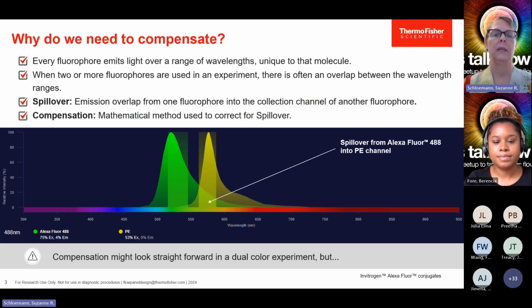So why do we need to compensate? We need to compensate because each dye has spectral properties and an emissions spectra. This area of green is what we call the emissions spectra, and in this case, it's for Alexa Fluor 488. And the yellow peak is PE. The shaded areas are the bandpass filters that are used to collect the data. The problem that we are observing right here is spillover of Alexa Fluor 488 into the PE channel. These are the false positives I was speaking of before.